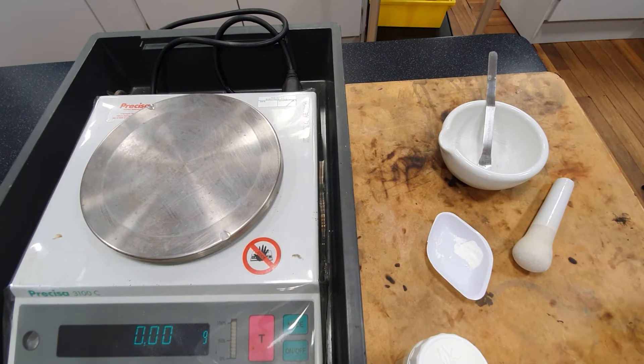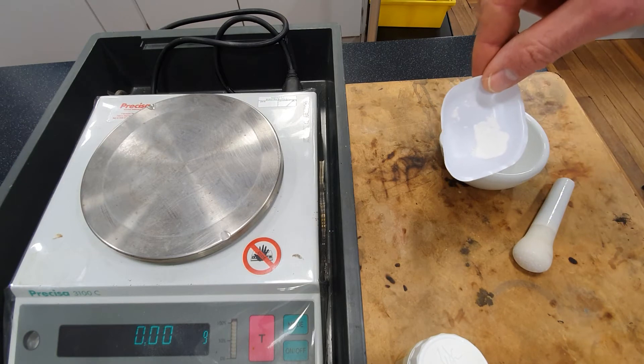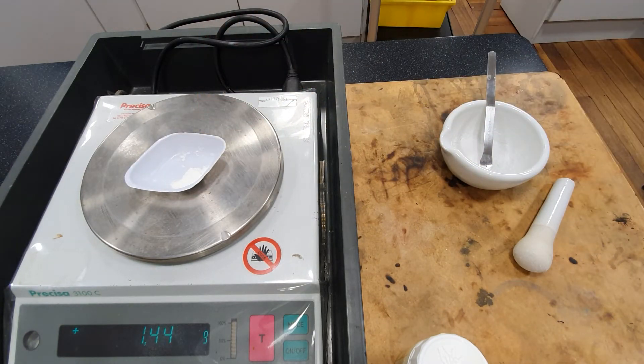Step 2, transfer the crushed tablet to a weighing boat and find their combined mass. Record the mass.